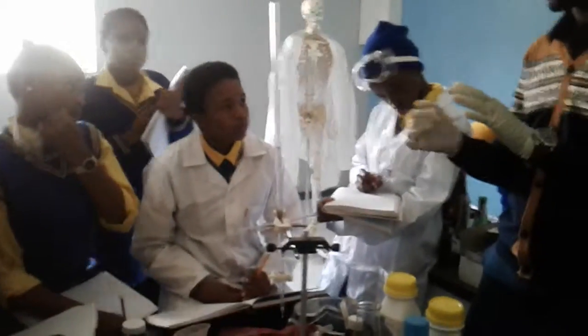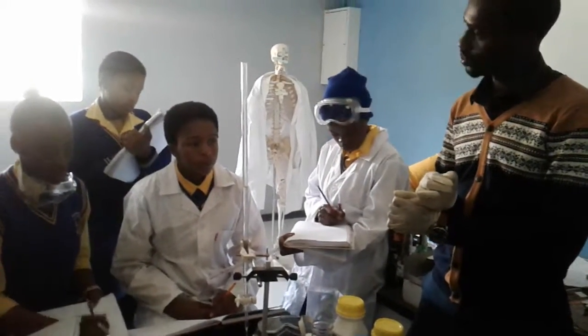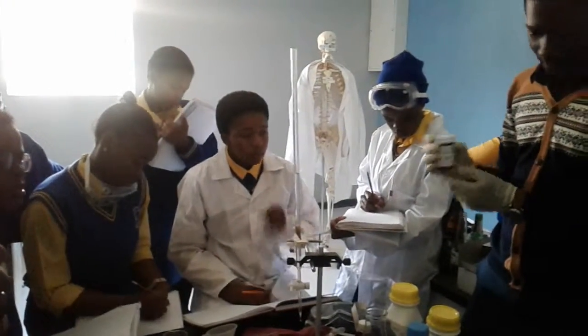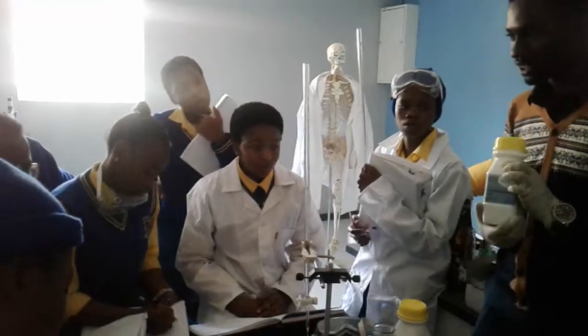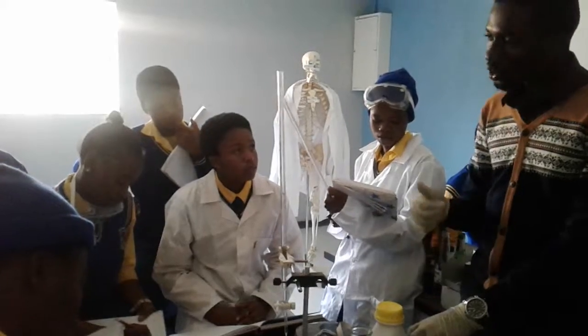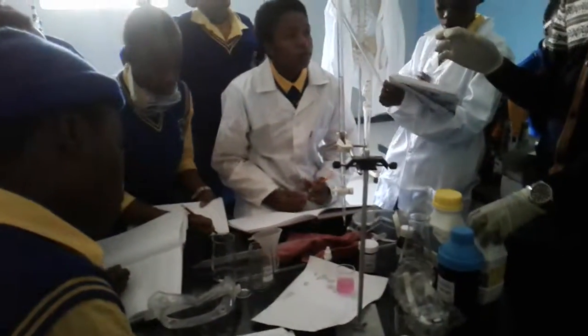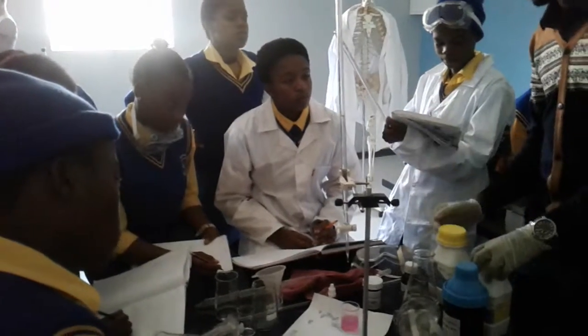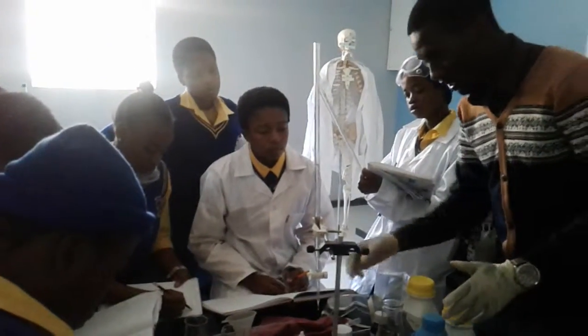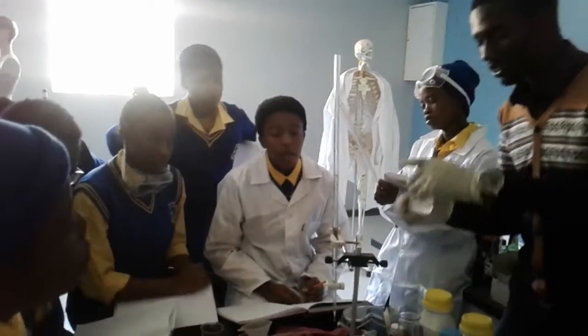Now what you need to do, I'm just doing this for you so that when you do it, you don't get confused. You write an equation. Do you know the formula of oxalic acid? Yes. Do you know the formula of sodium hydroxide? Yes. What will an acid and a base produce? Salt and water. So that's going to be your equation, and I'm sure it's also in your books. You might do it today, you might not, but as long as you know how it's done.